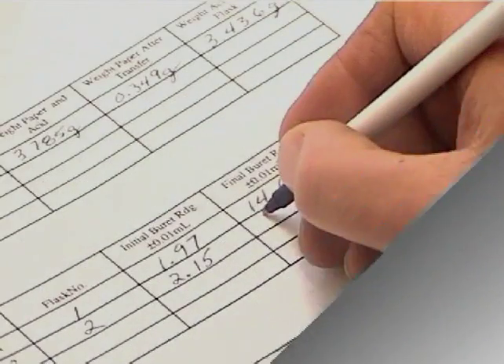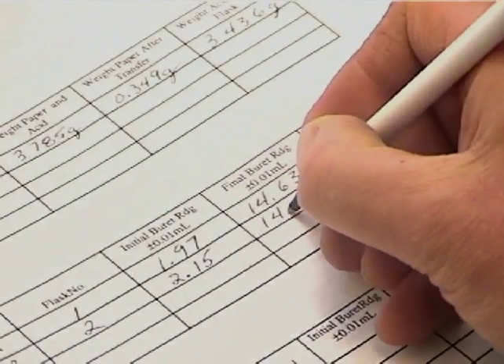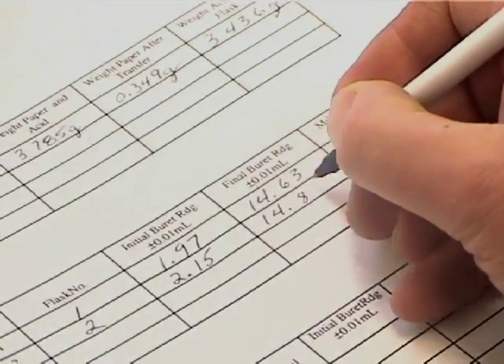For good trials, be certain to record your final burette reading directly into your lab manual.